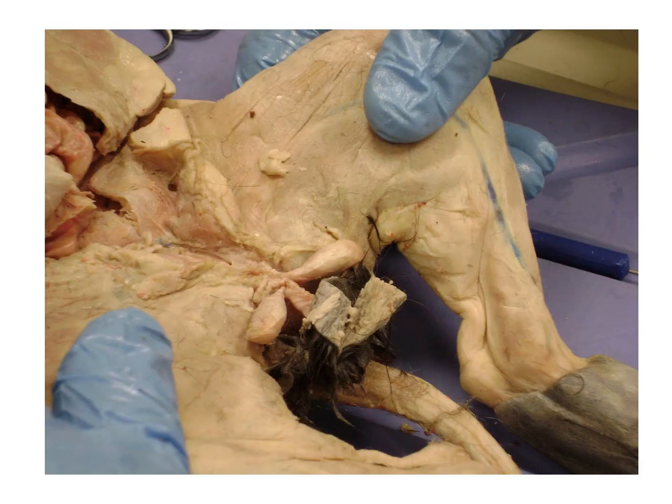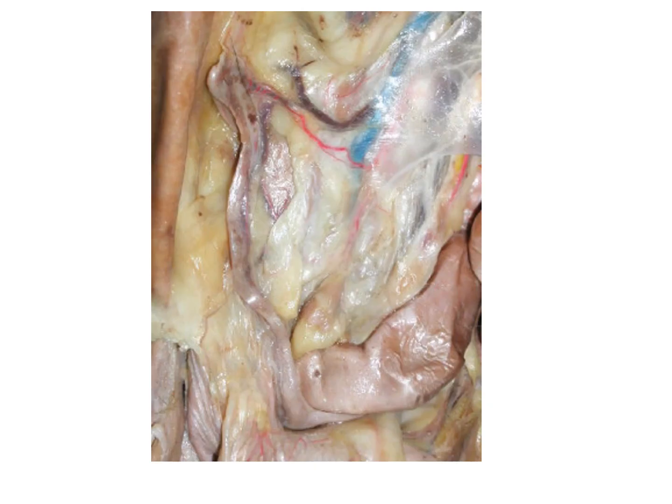And this is another picture of a cat, a male cat. The 2 testes are right here. And then this structure that you're seeing is a uterine horn. And it comes down like this. And up here, this little bulge is the cat's ovary.